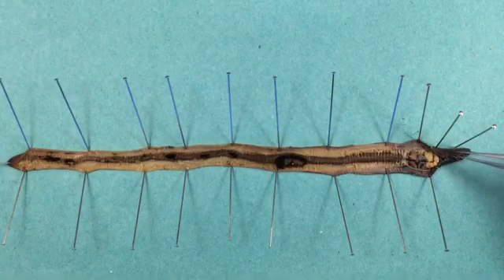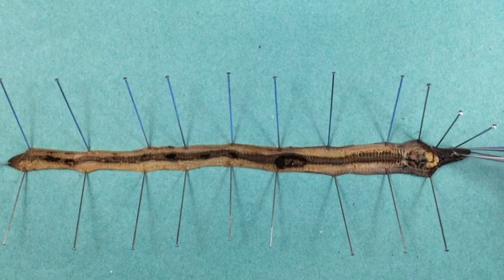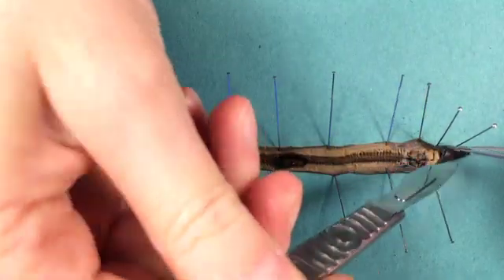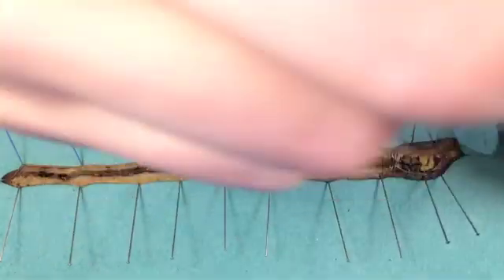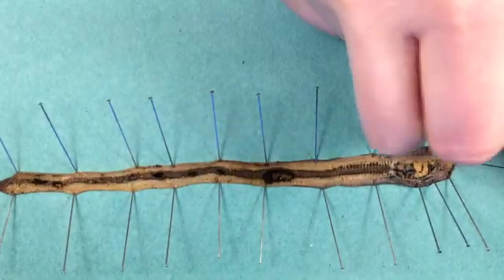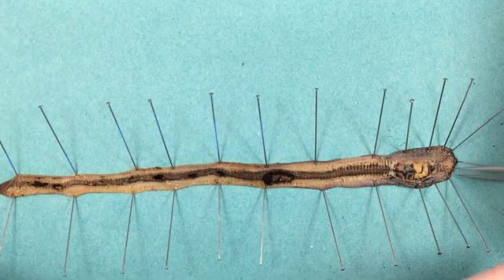Same with segment 10 — I'm going to take the reference marker out and use it by pinning it into the worm. You can actually see here the cuticle is just coming away — there's this little skinny bit just here. That's a bit of cuticle because the worm is actually covered in cuticle. I'm going to pop up a couple more pins and then the earthworm is opened up and we're ready to have a look at the structures.